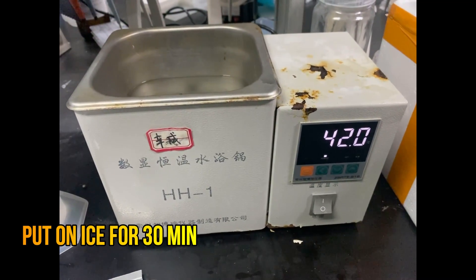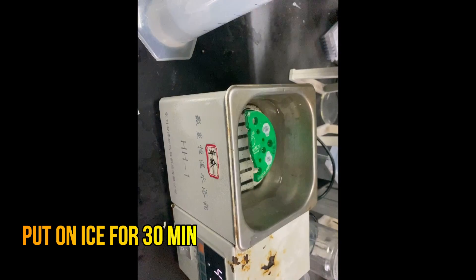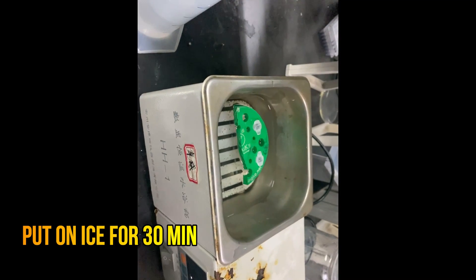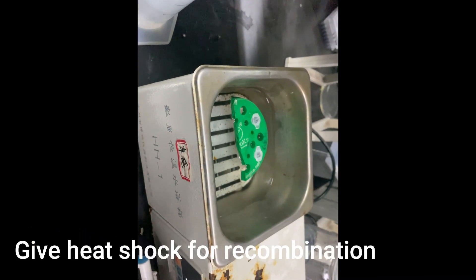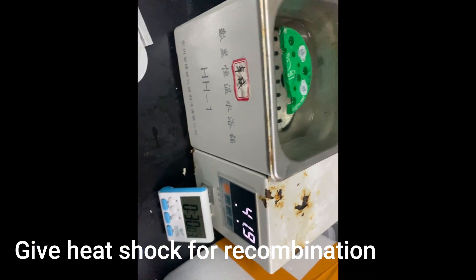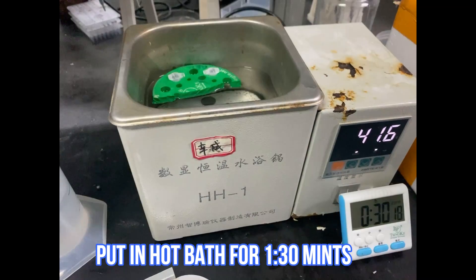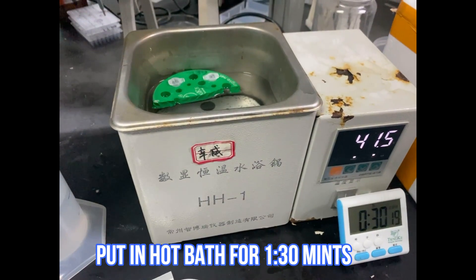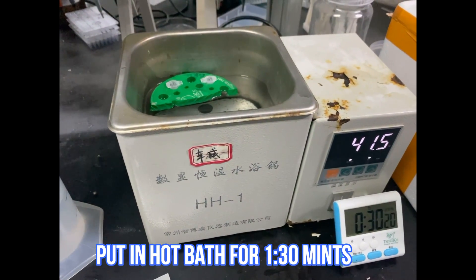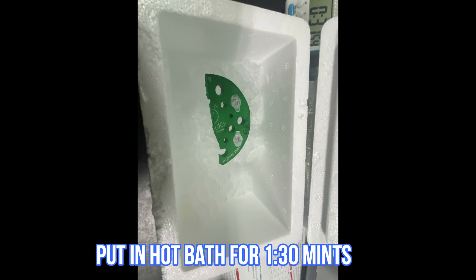We will heat a water bath up to 42 degrees Celsius. We need to give a quick heat shock at 42 degrees Celsius in the hot water bath, and then transfer it back to ice.